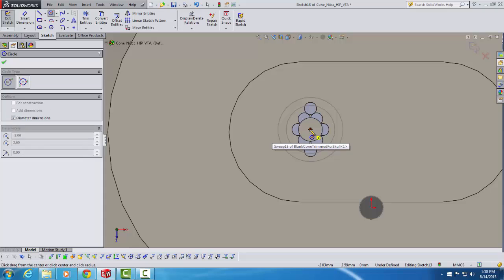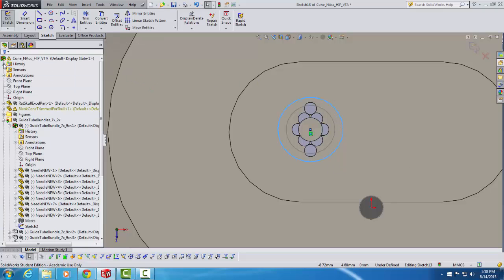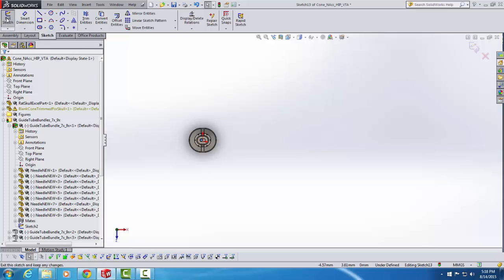When I do that, I'm going to hold down the left mouse key. I'm going to pull this circle outward until I get the outermost circle. There's two circles here. This one is for drilling holes for a 7x bundle, and that's not what we're doing here. We're using a 9x bundle. So we're going to go out until this outer circle turns orange, let go of the left mouse button, and now we've drawn the correct circle. And we want to hit green check to make that circle permanent. And then we have to go over to the upper left and click Exit Sketch.